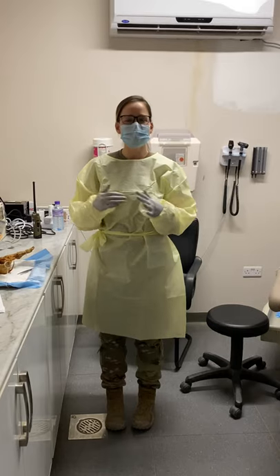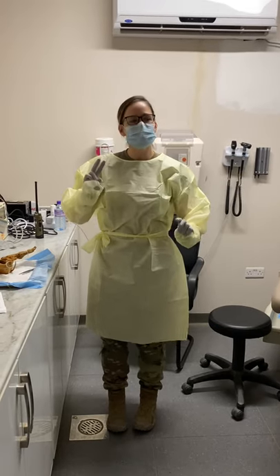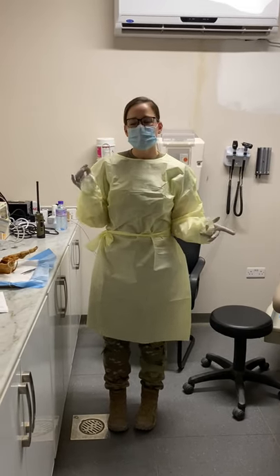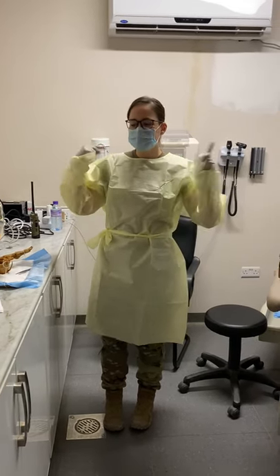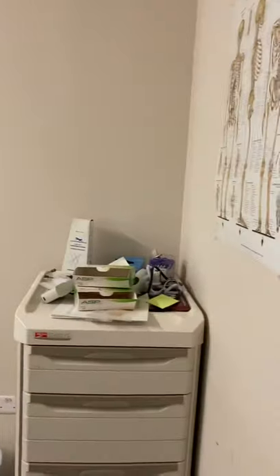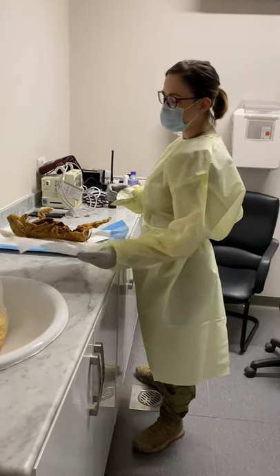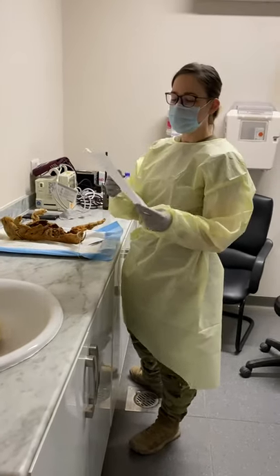Alright, so, Jocelyn, today is for my Anatomy & Physiology II class. We'll do a quick scan around the room, make sure that there's no cheating material or anything like that. And today I'm just going to be doing the fetal pig digestive system dissection.